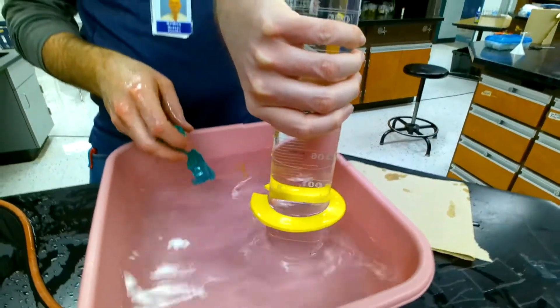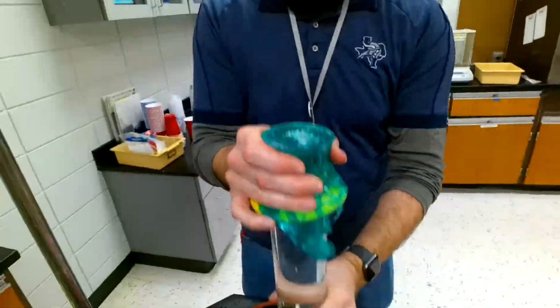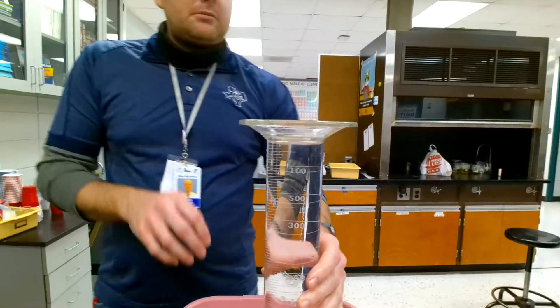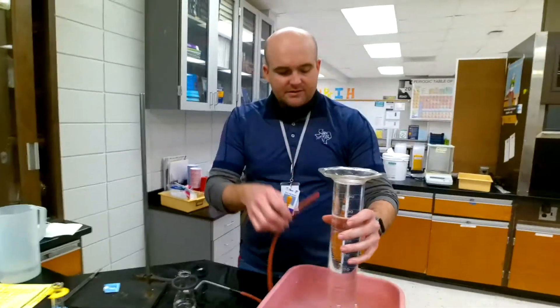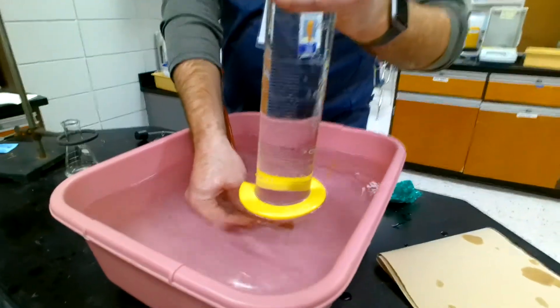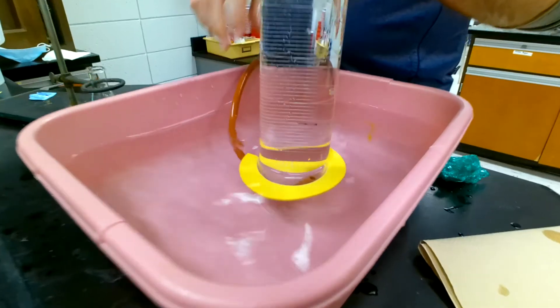I'm going to try that one more time. Okay, we've got a little bit of air bubble right there, but that's all right. What we're going to do is we're going to take the end of this gas pressure tube, and it's going to be on the middle on the inside right there. Now we're going to leave that alone.